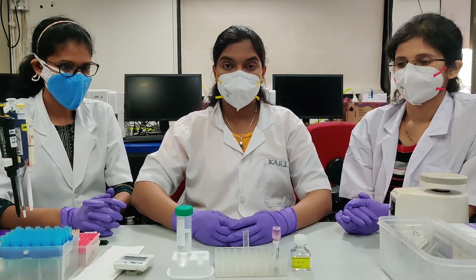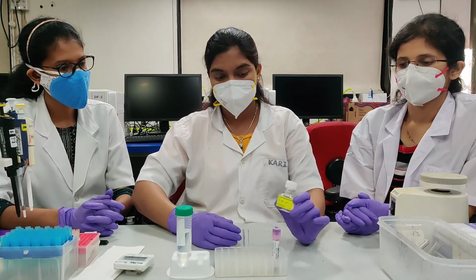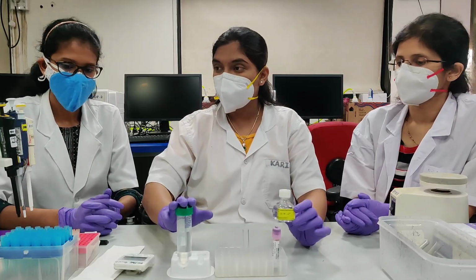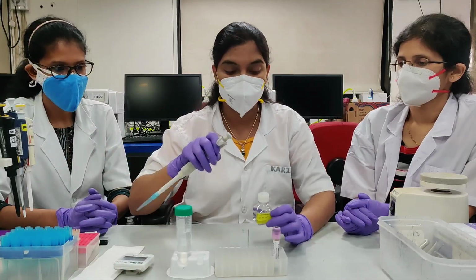Meanwhile, we will prepare fresh 1x lysing solution. This is 10x lysing solution. We have to take 1 part of lysing solution and 9 parts of distilled water. For 1 tube, we require 2 ml. We will prepare total 5 ml of lysing solution.